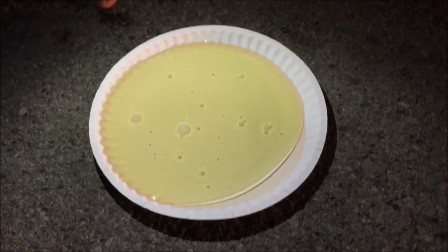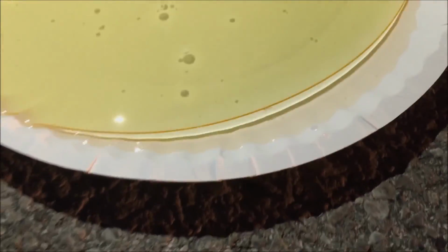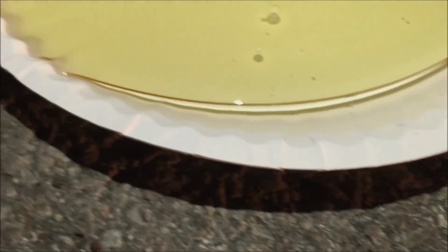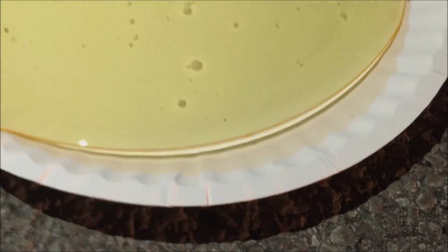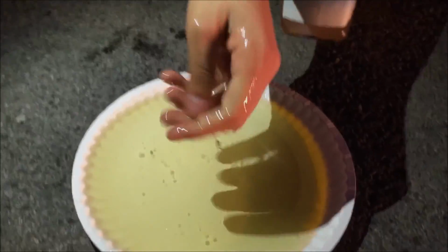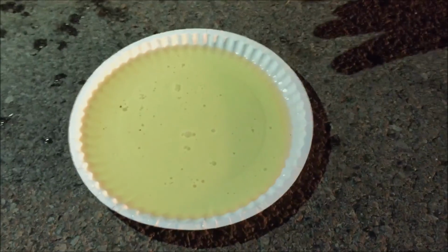Okay, see that little bubble floating down. Oh, that was weird. Look at this nice, cool little separation right here between the water and the oil at the end of the plate. Yep, right there, little crescent. It's a nice little happy smiley face. No, it's a chemistry thing. Are you ignorant? And this is why we have Gary, to do ignorant things that we don't want to do. Squishy. Well, Gary, it's oil. The dingus. You ding-a-ling.